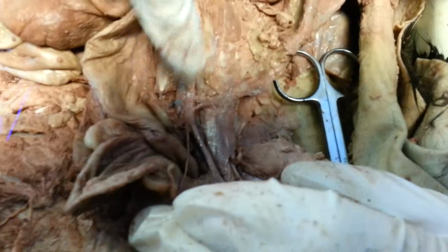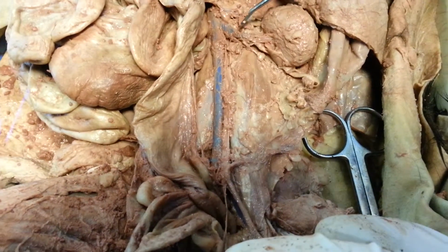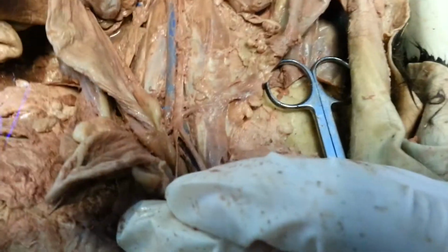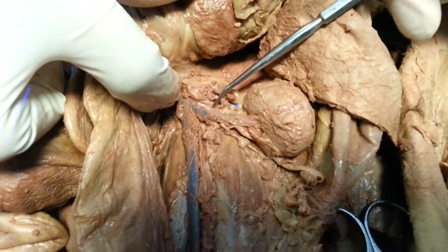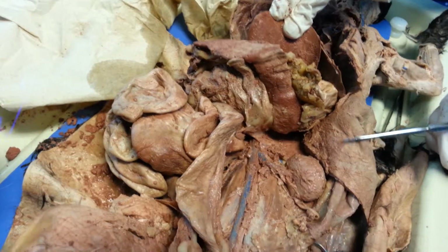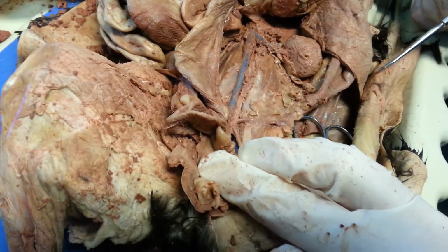Actually, there's a couple of branches off, and I can't remember what I asked you guys to know. The externals and the internals, I believe. And also we get one pair of branches, the renal arteries. We can see the renals coming off here, supplying the kidneys. And you have a couple of unpaired ones as well: the superior and inferior mesenteric and the celiac artery, which feed the different internal organs down here. But I don't think you're going to be able to recognize them in the cat.